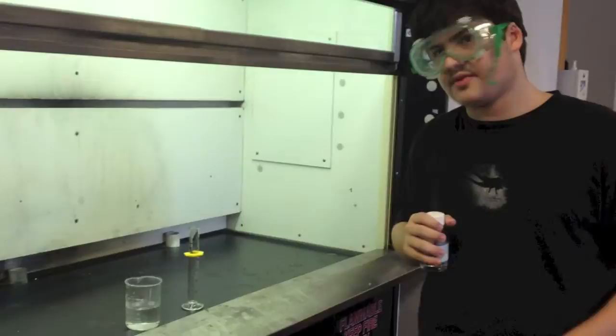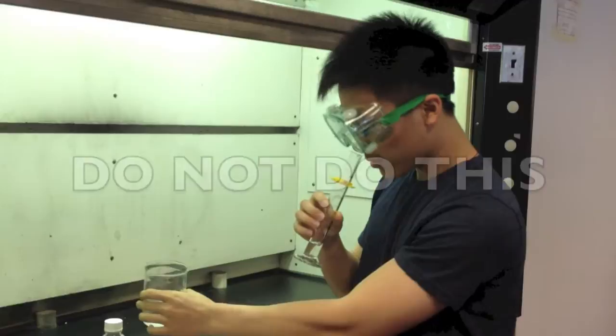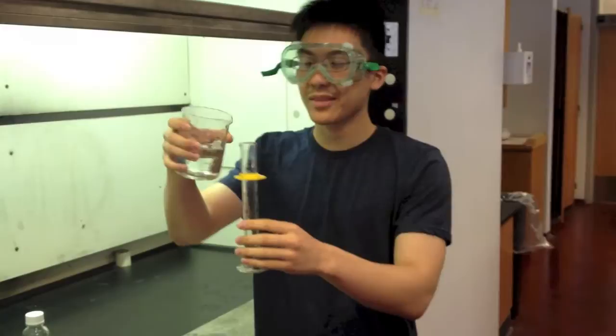Alright, now we're about to pour the sulfuric acid into the water. Remember to do this in the fume hood. Remember not to add water to acid because it's a very exothermic reaction. Hey, what are you doing?